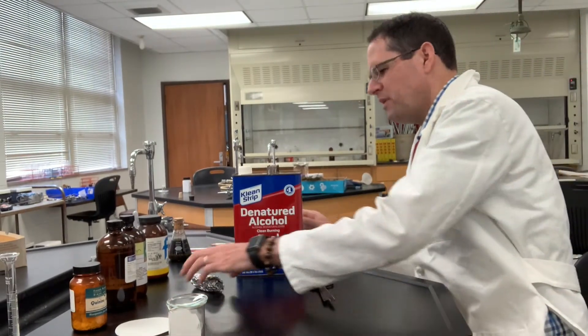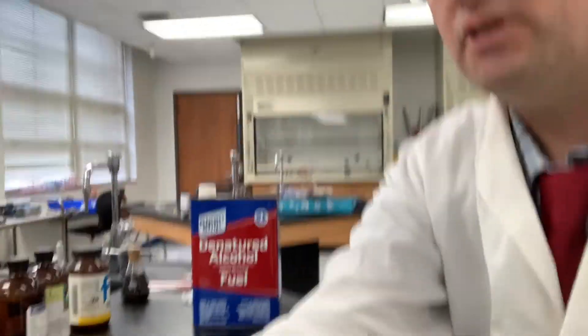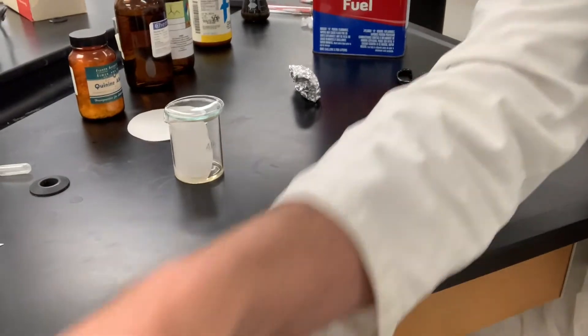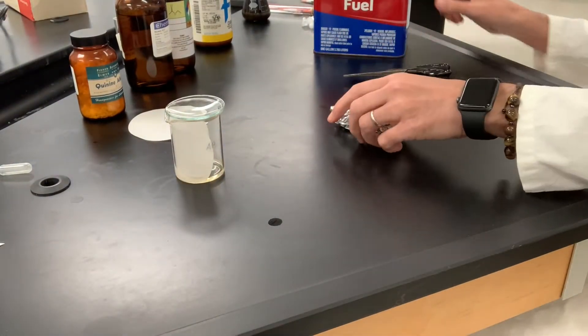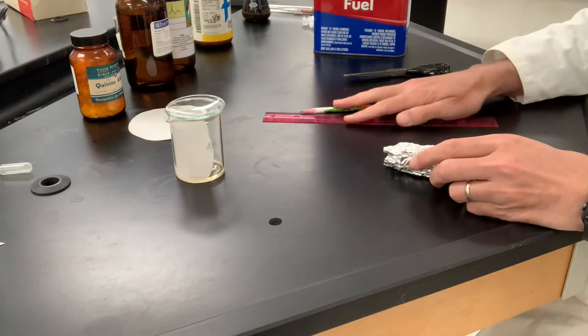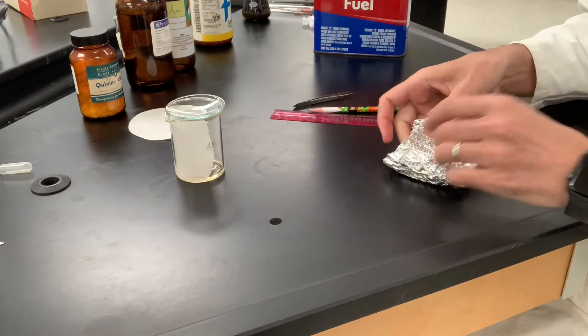All right, next we're going to prepare our TLC plate. I think I'll reposition the camera over here so you can kind of see better what's going on. So those are the ruler, pencil, forceps.